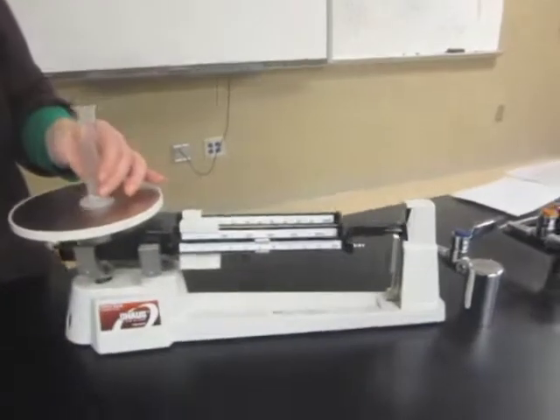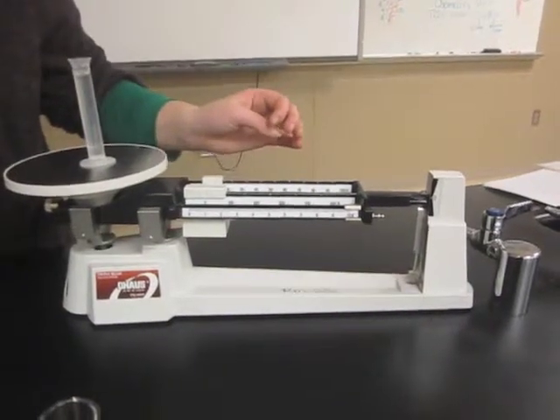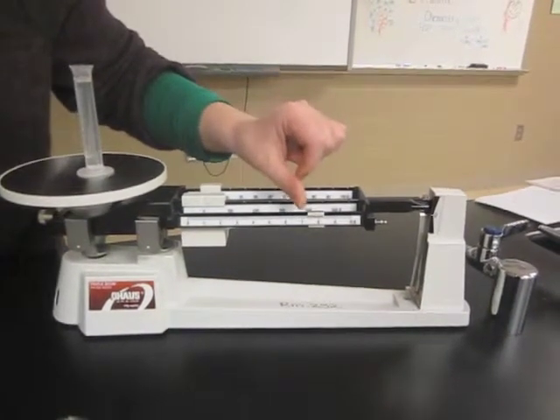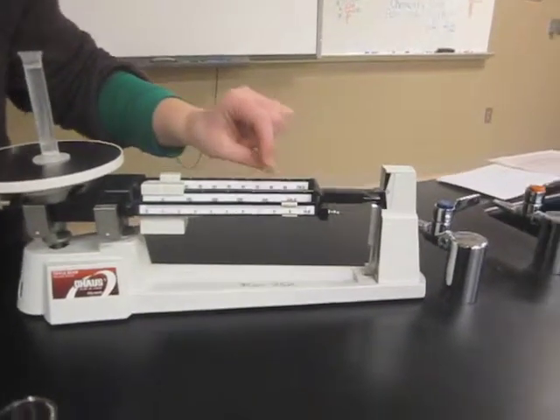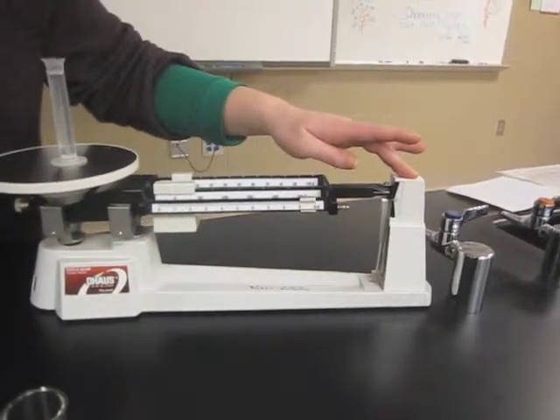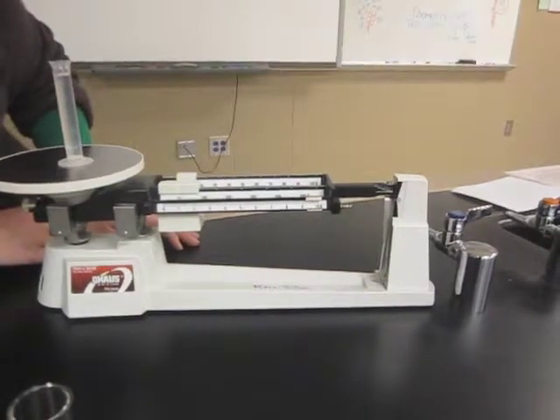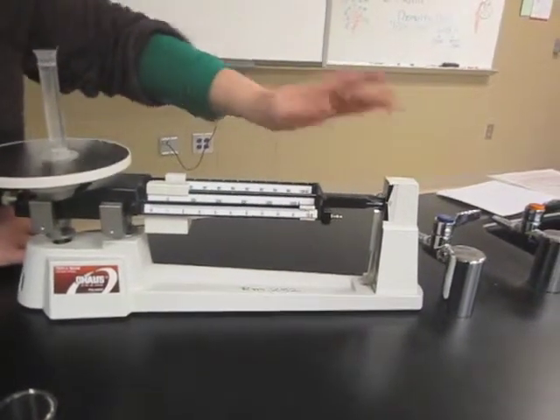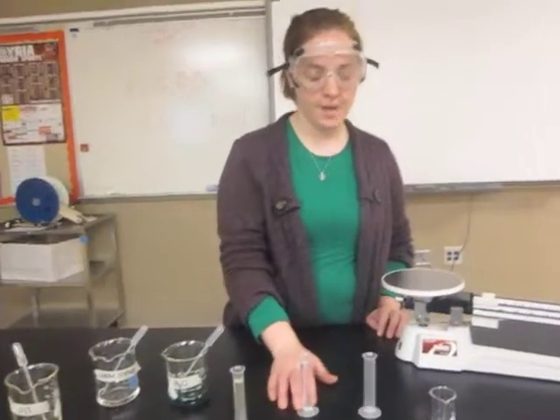Once again, you'll need to find your final mass. You can let it come to rest as close as possible. The final mass will be very close to 20 grams. So you'll call your final mass 20 grams, and you need to subtract it minus your empty graduated cylinder mass.